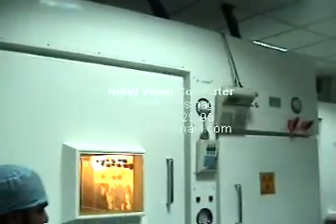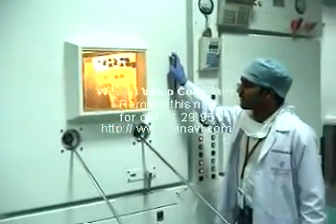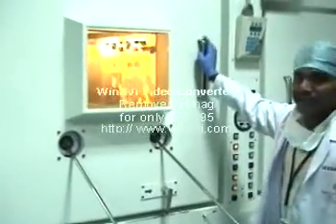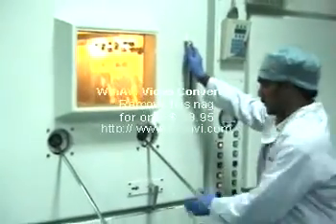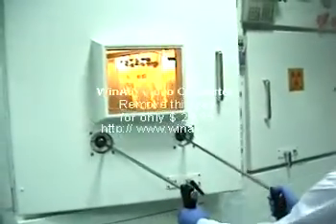Now I will try to open the dispensing system. This is our dispensing system — here we dispense the doses to the patients. You can see inside; these are the manipulators.